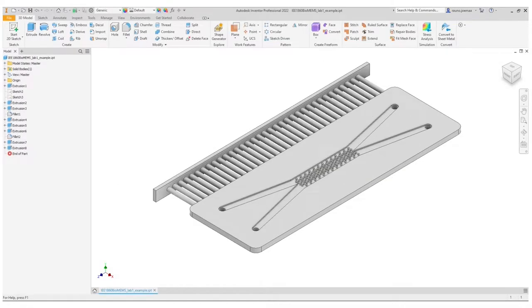In this lab, we will simulate without the micropillar extrusions inside the channel. Therefore, we need to remove the extrusion. Locate your micropillar extrusion feature on the model ribbon. Hovering over the different features highlights the feature on the 3D view. Select the right feature. Right-click and choose Suppress feature.